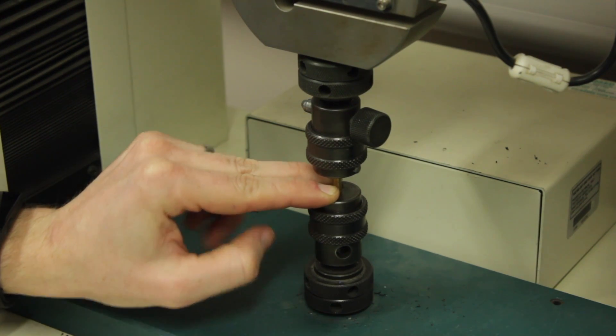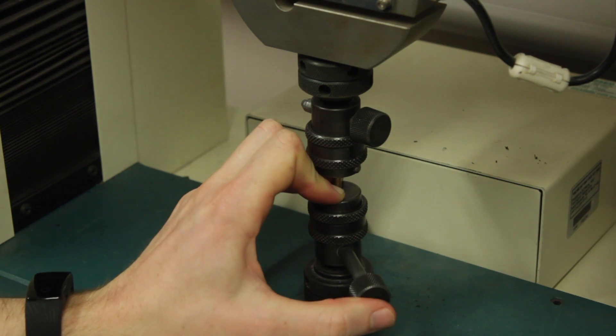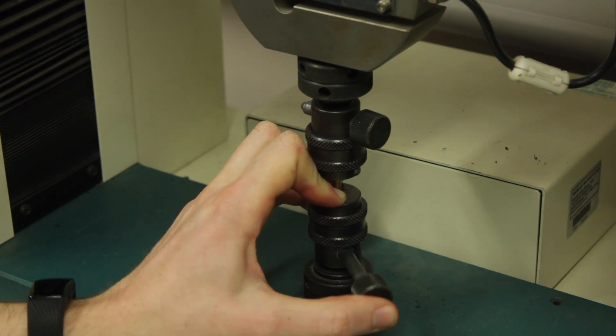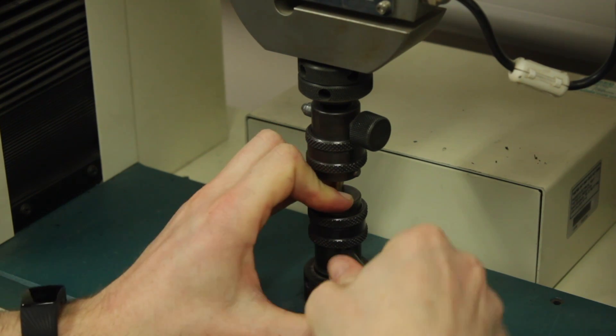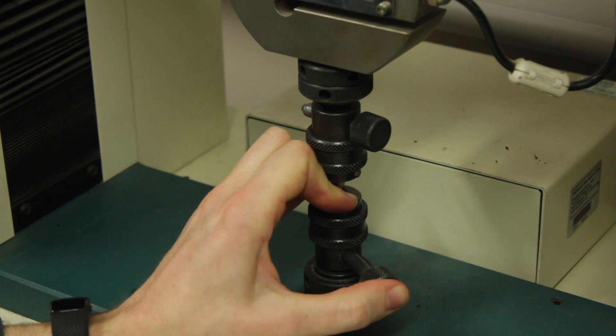Once in incremental jog mode, insert the pin with one hand, hold it in position and lower the bar one step at a time until the pin goes in. This is to ensure that the tensile test specimen is not preloaded.